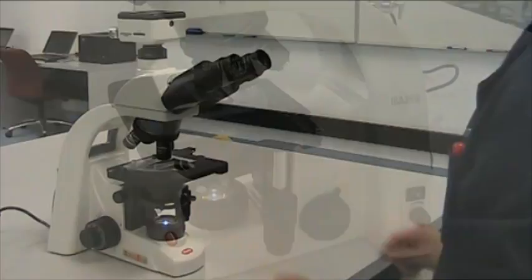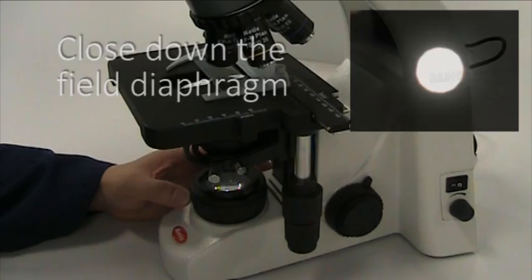Once you have the specimen focused and are comfortable using both eyes, close down the field diaphragm until the aperture fills about one third of the field of view. The edges may be fuzzy.